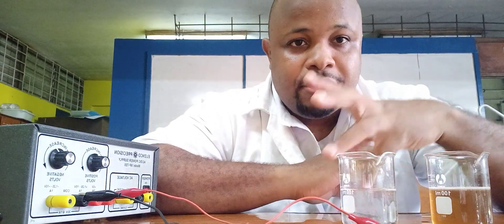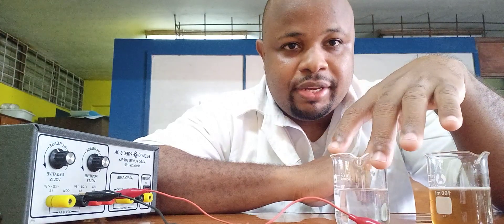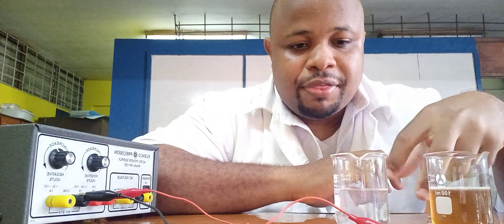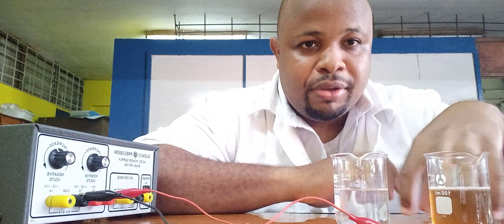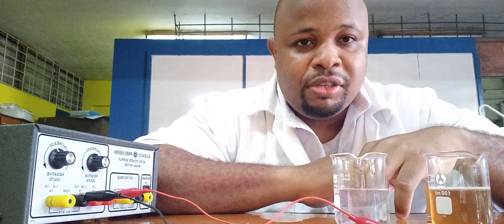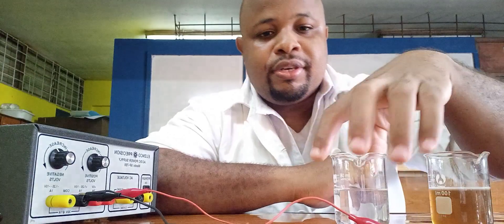The first solution we have is sodium chloride — table salt. From the theory, we said that ionic compounds can conduct an electric current when molten or in solution. Here we have it in solution, so we are going to see if it is able to conduct an electric current.